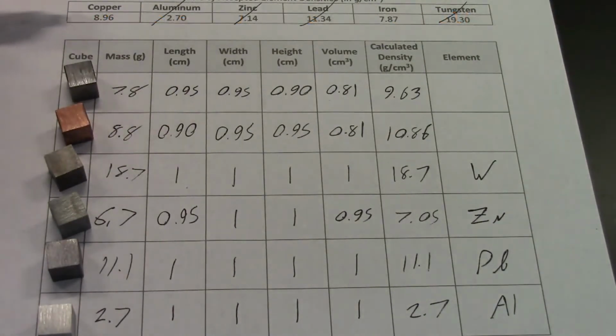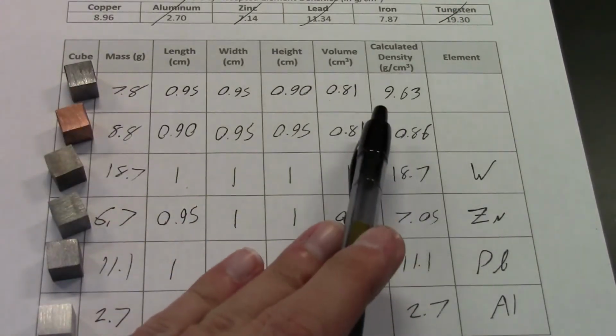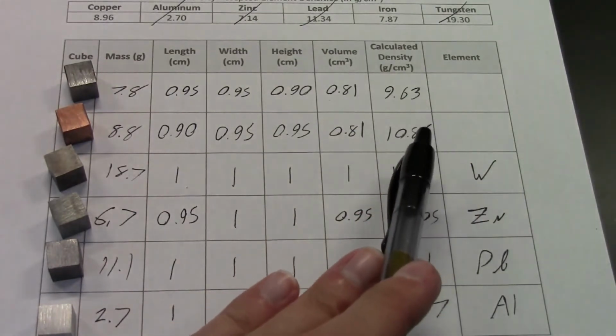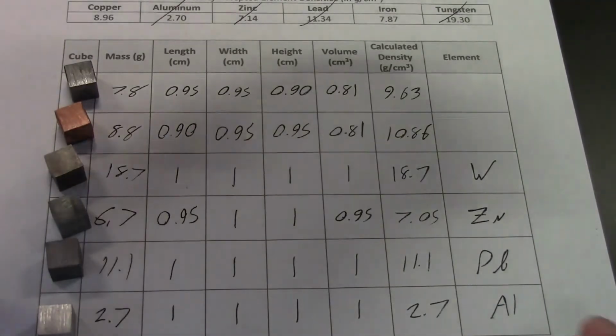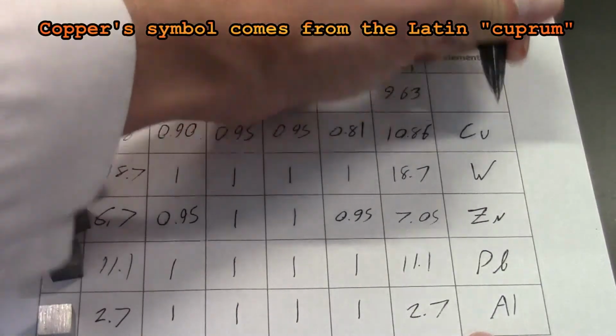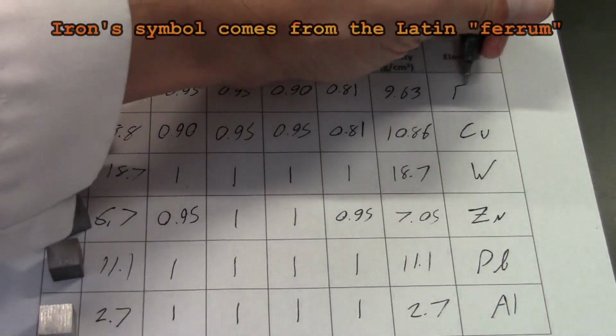And then now all we've got left is copper and iron. Copper is 8.96, which is kind of far off from both of these. And iron is 7.87, which is still pretty far off. So our densities aren't quite right. But as you might know, copper is a reddish metal, so I think it's fairly obvious that this one should be copper. The symbol for copper we have is Cu. And in process of elimination, that leaves iron as our last one as Fe.